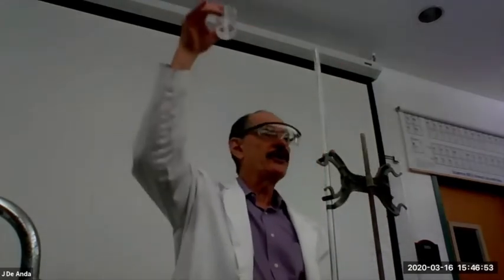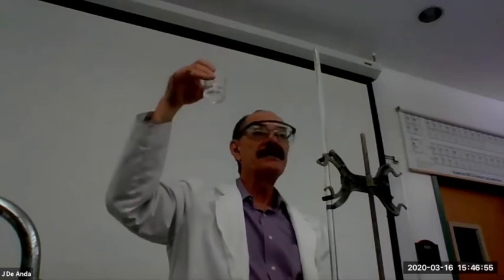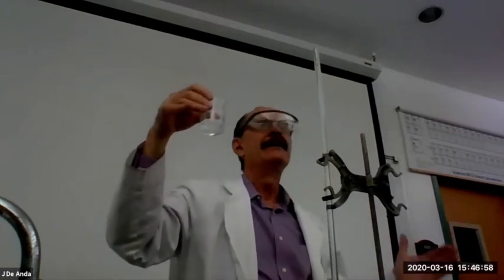Don't throw away your KOH, because we're going to need it for a future experiment. Well, assuming we get to do it. Right now, it doesn't look like we will, but I want you to keep it anyway.